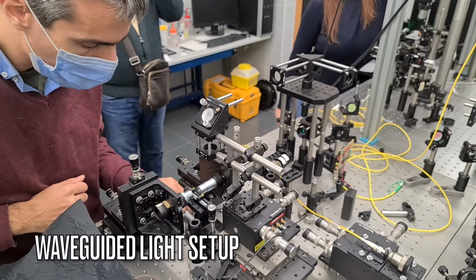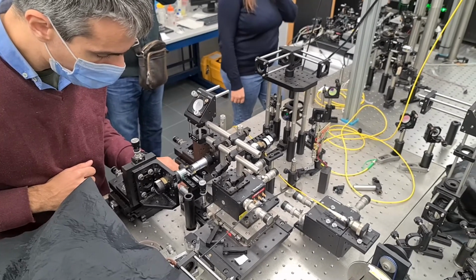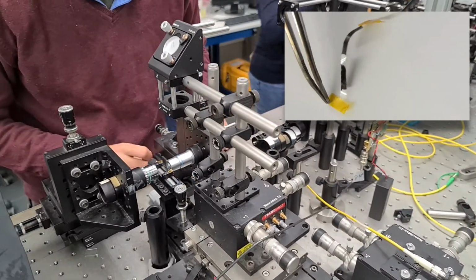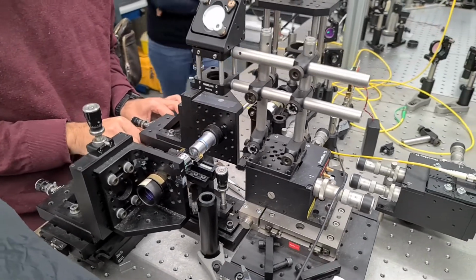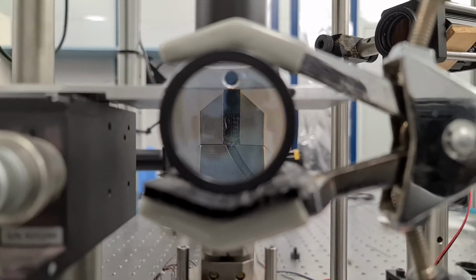Here, we show the setup where we characterize waveguided light emitted by the active material, in our case the lead-free perovskite film, deposited by inkjet printing on a transparent flexible substrate, as we can see in the floating video. When laser excitation is high enough, amplified spontaneous emission is outcoupled from the waveguide and analyzed with the spectroscopic setup.